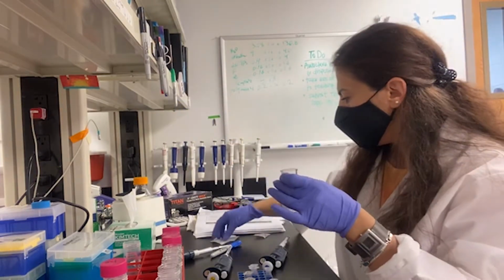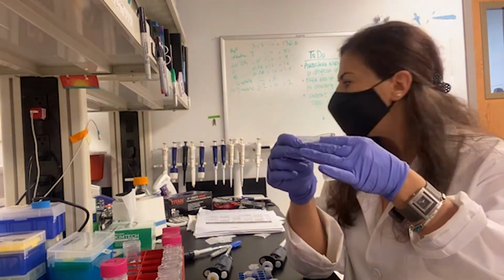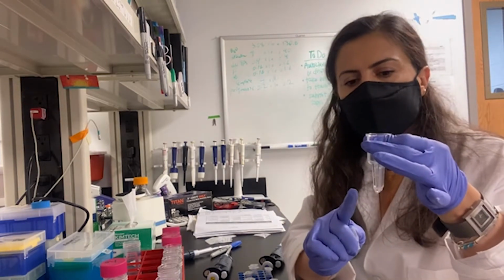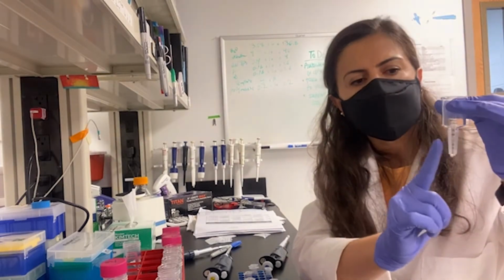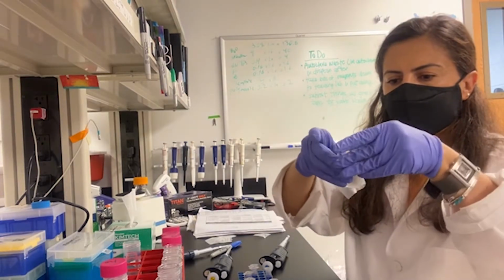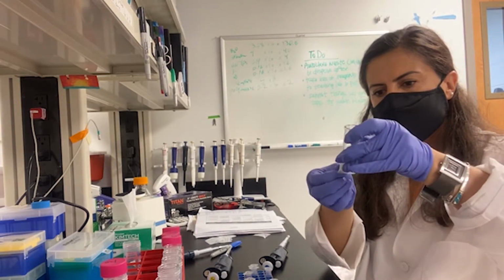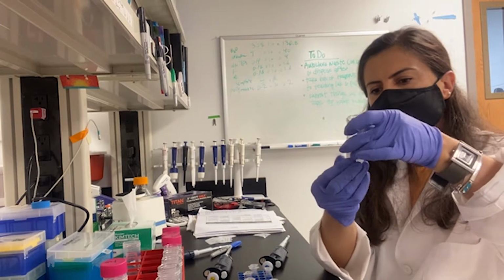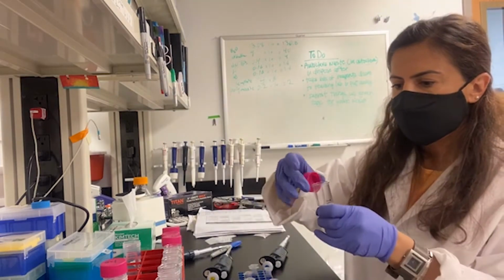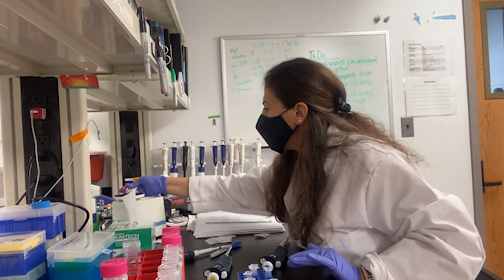Now I'm going to wrap around this membrane part, and then I'm going to vortex it a bit, so that all the proteins or the genetic material stuck to the membrane come off. So gently and appropriately cover all the membrane parts so it doesn't leak, so we don't lose sample. And then I'm going to use the cap, tightly holding the cap. I'm going to vortex it a bit.